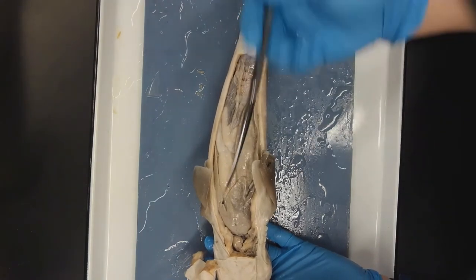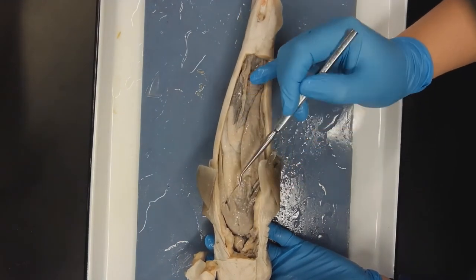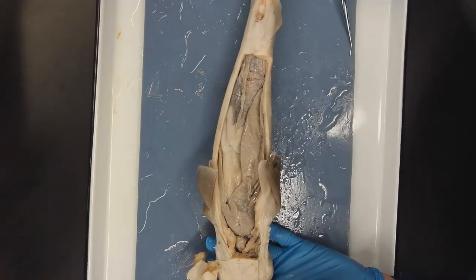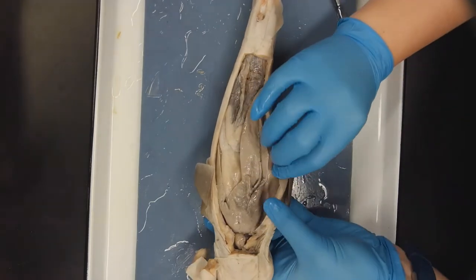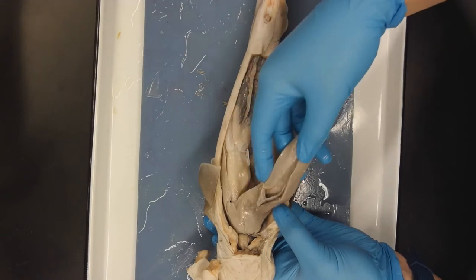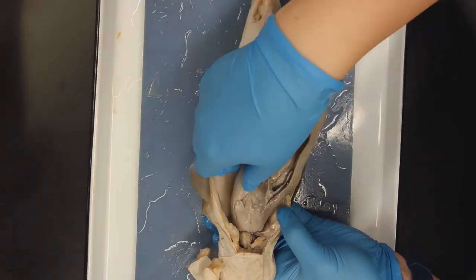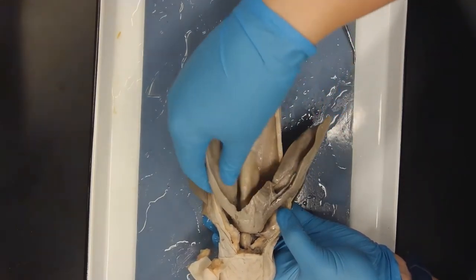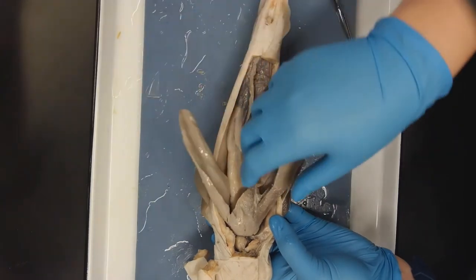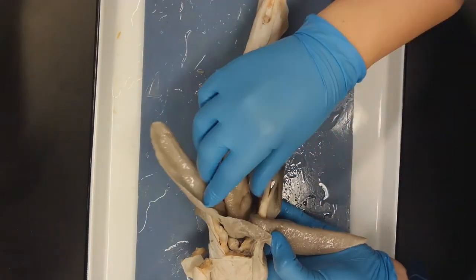First we will see the heart, which I am pointing to right now. Next I'm going to show you the multi-lobe liver, an extremely large and oily structure. Since this class of animal does not have a swim bladder like teleost or bony fishes, the liver of the dogfish also functions for buoyancy of the animal.